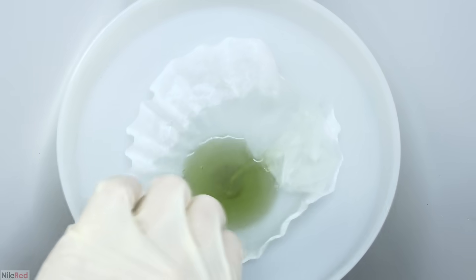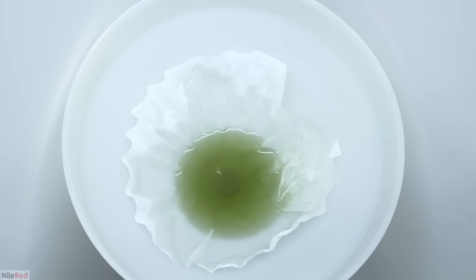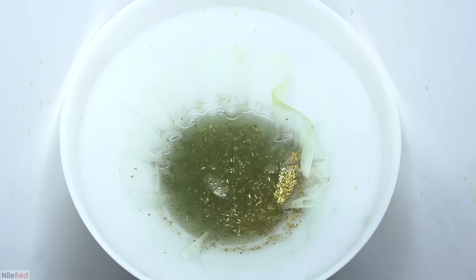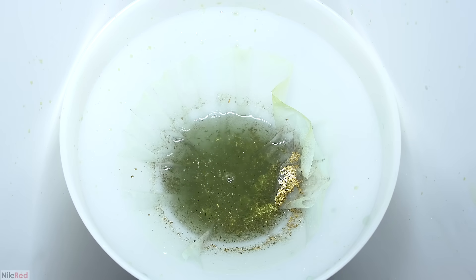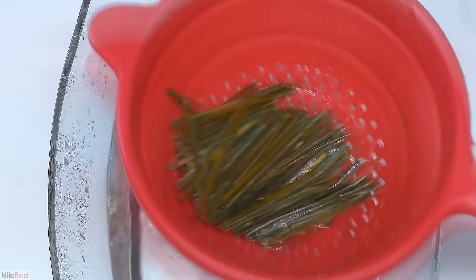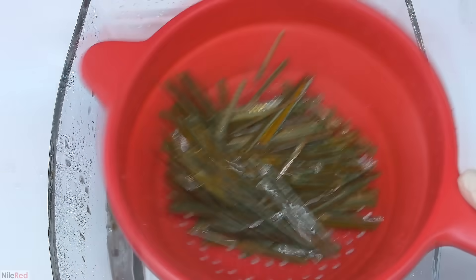It would have been a huge mess if I added from the bowl directly, so instead I just scooped out small portions using a beaker. Unlike last time this filtering step didn't take too long because I didn't wash things with way too much water and I only had something like a liter or two to filter through. We eventually get to the end of adding all of our greenish liquid, I washed the beaker a little and let the final remains drip through. While waiting for the last bit to filter through, I took my strainer with the RAM trimmings and gave them a little bath. The gold could be removed pretty efficiently just by dipping them occasionally and then shaking the strainer around.